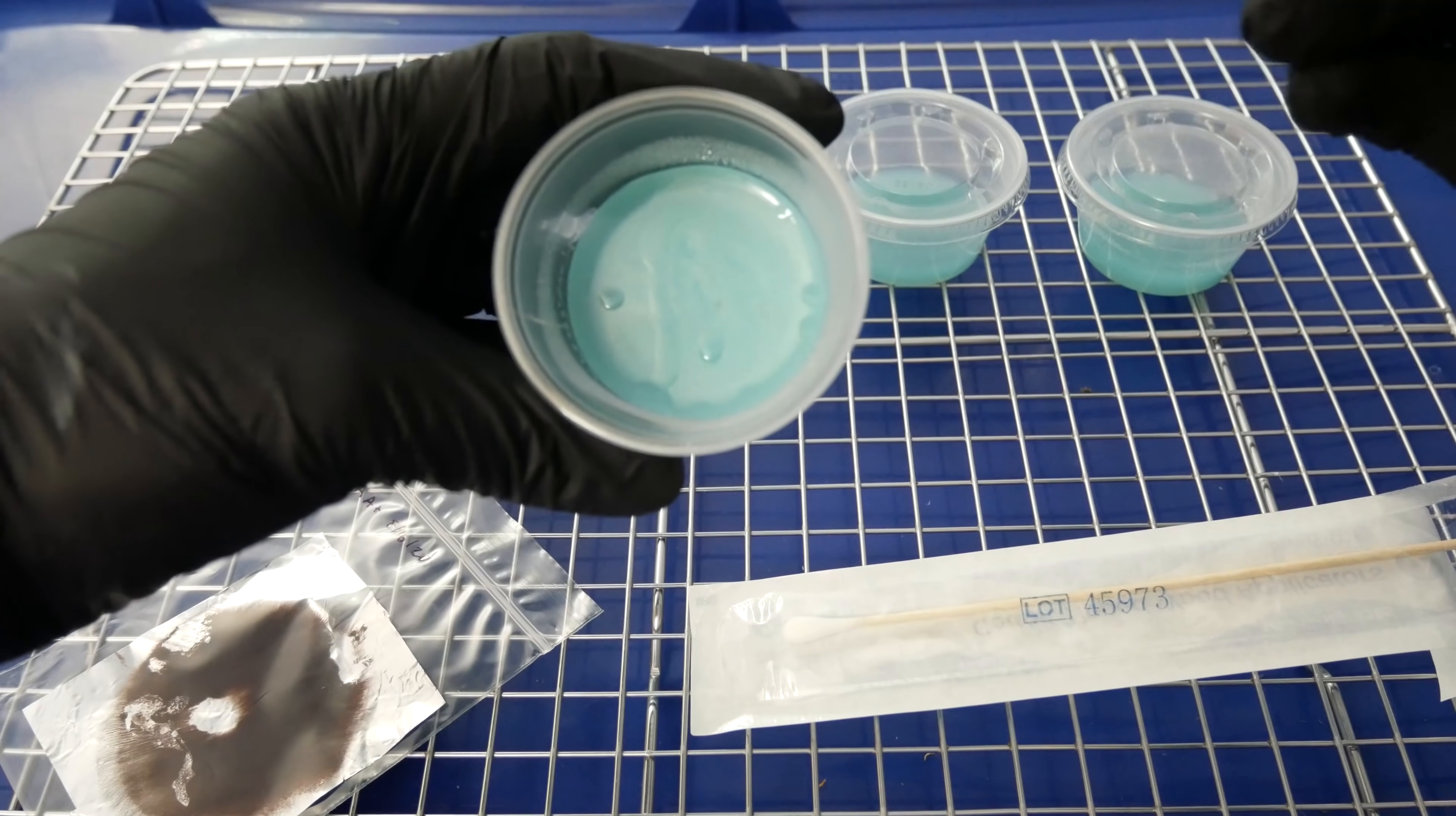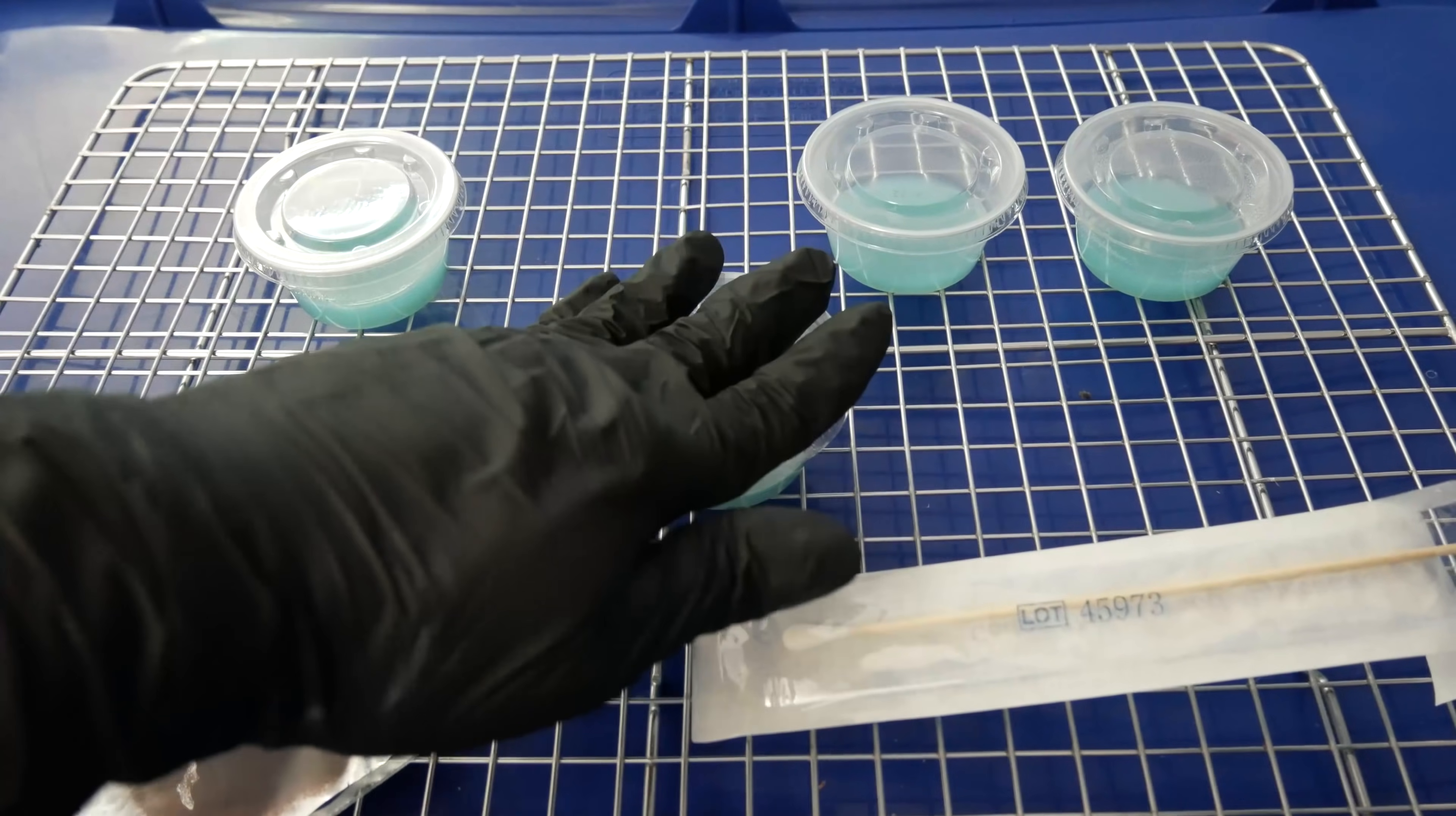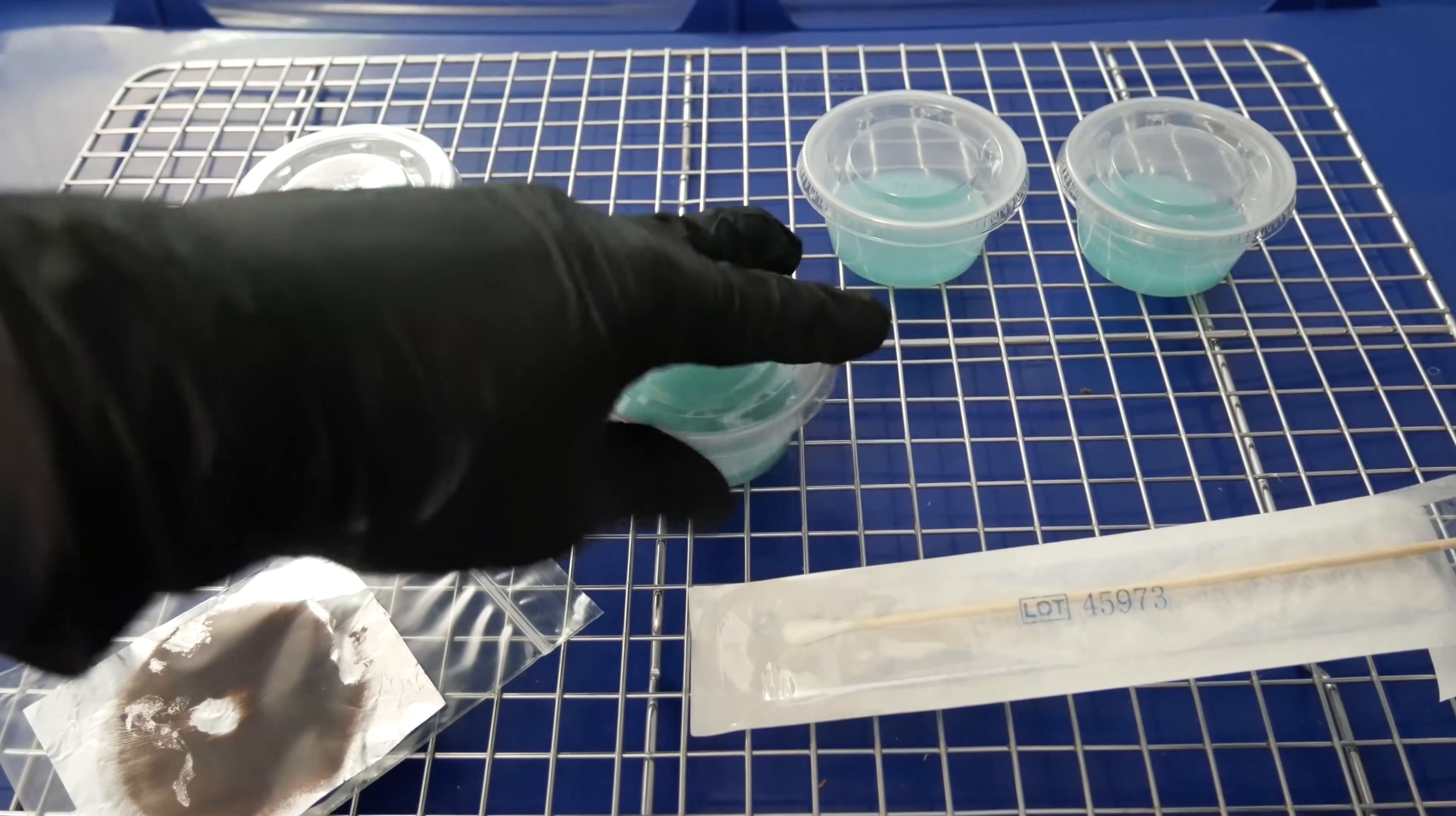Anyhow, the process is going to be the same as before. Go ahead and spread these across our dishes. I'll speed up the video and I'll see you guys in a little bit here, and I'll show you guys the result.